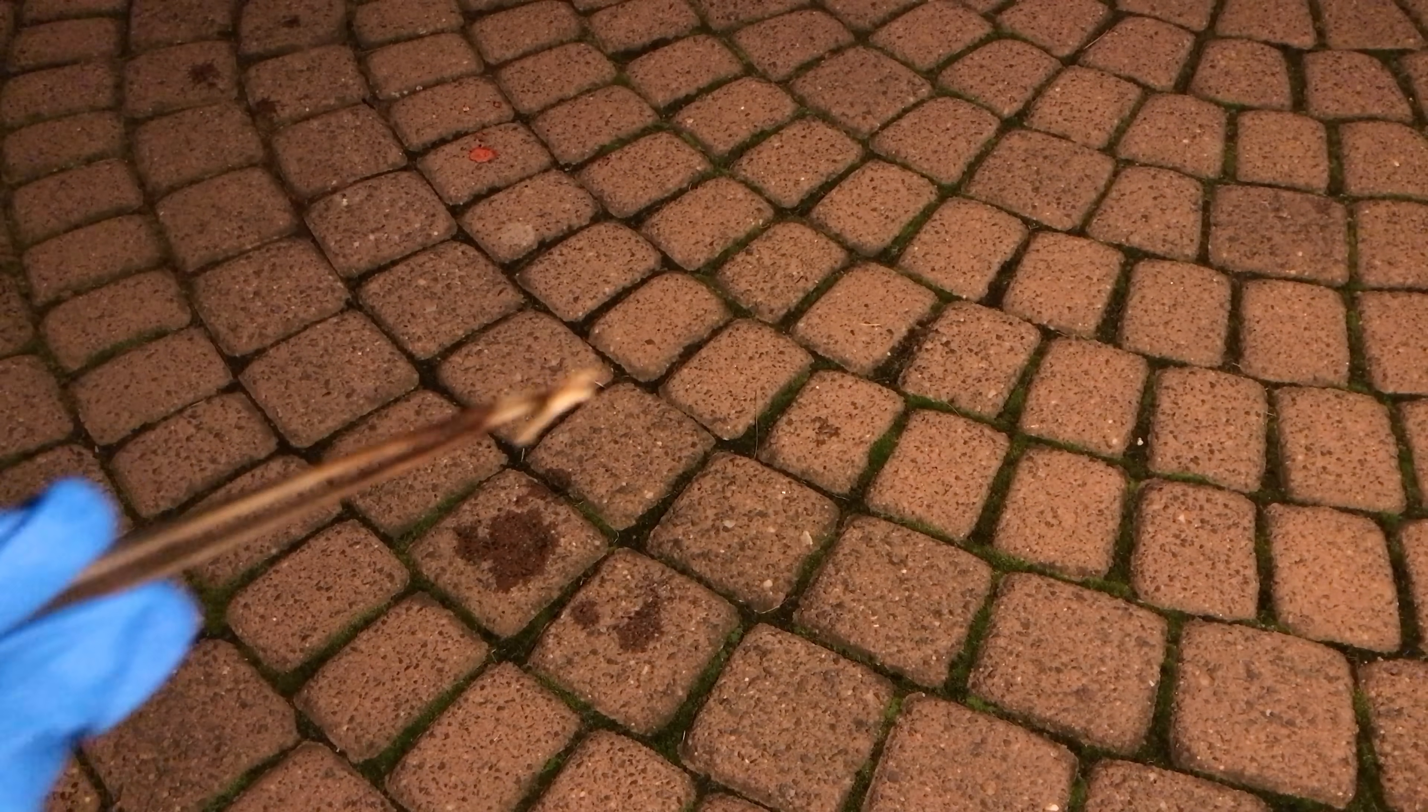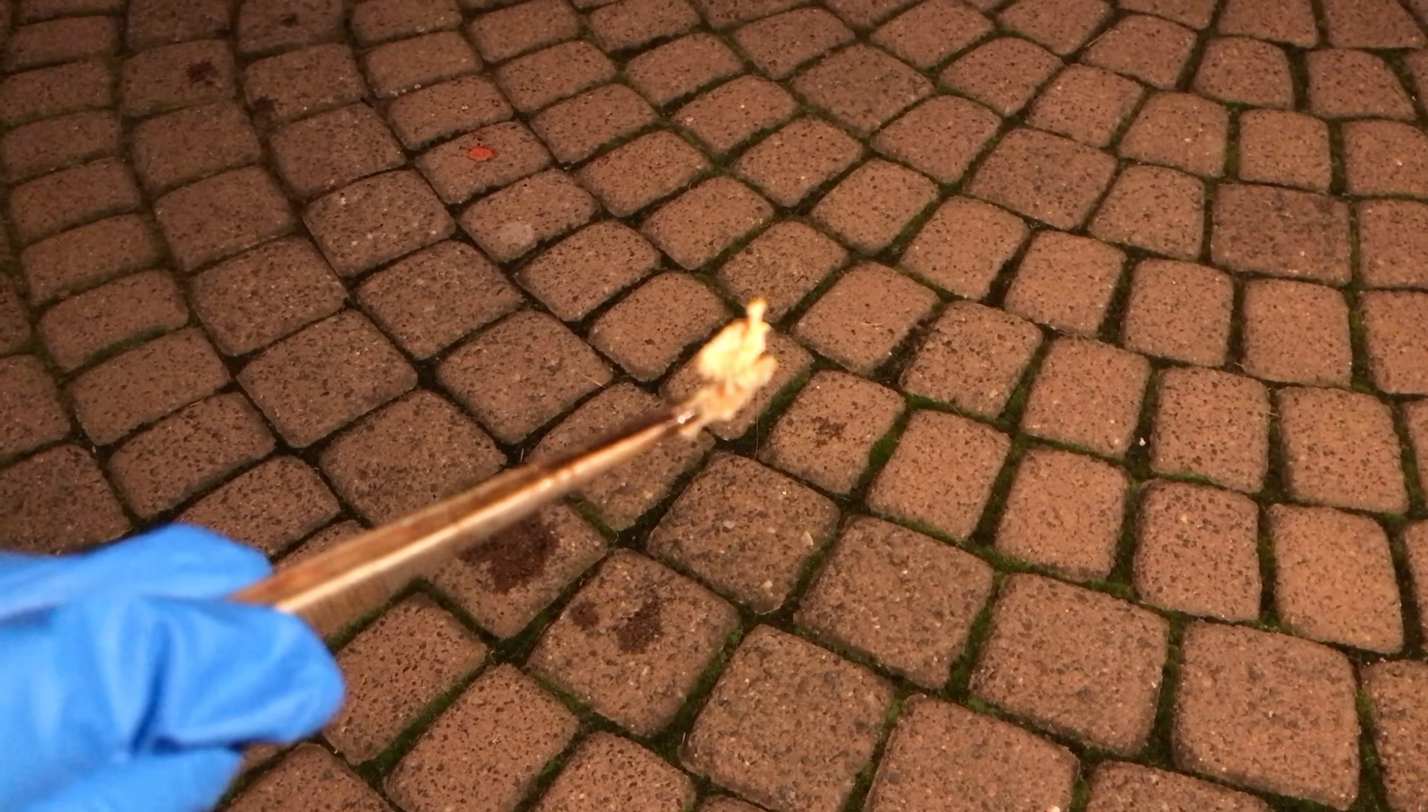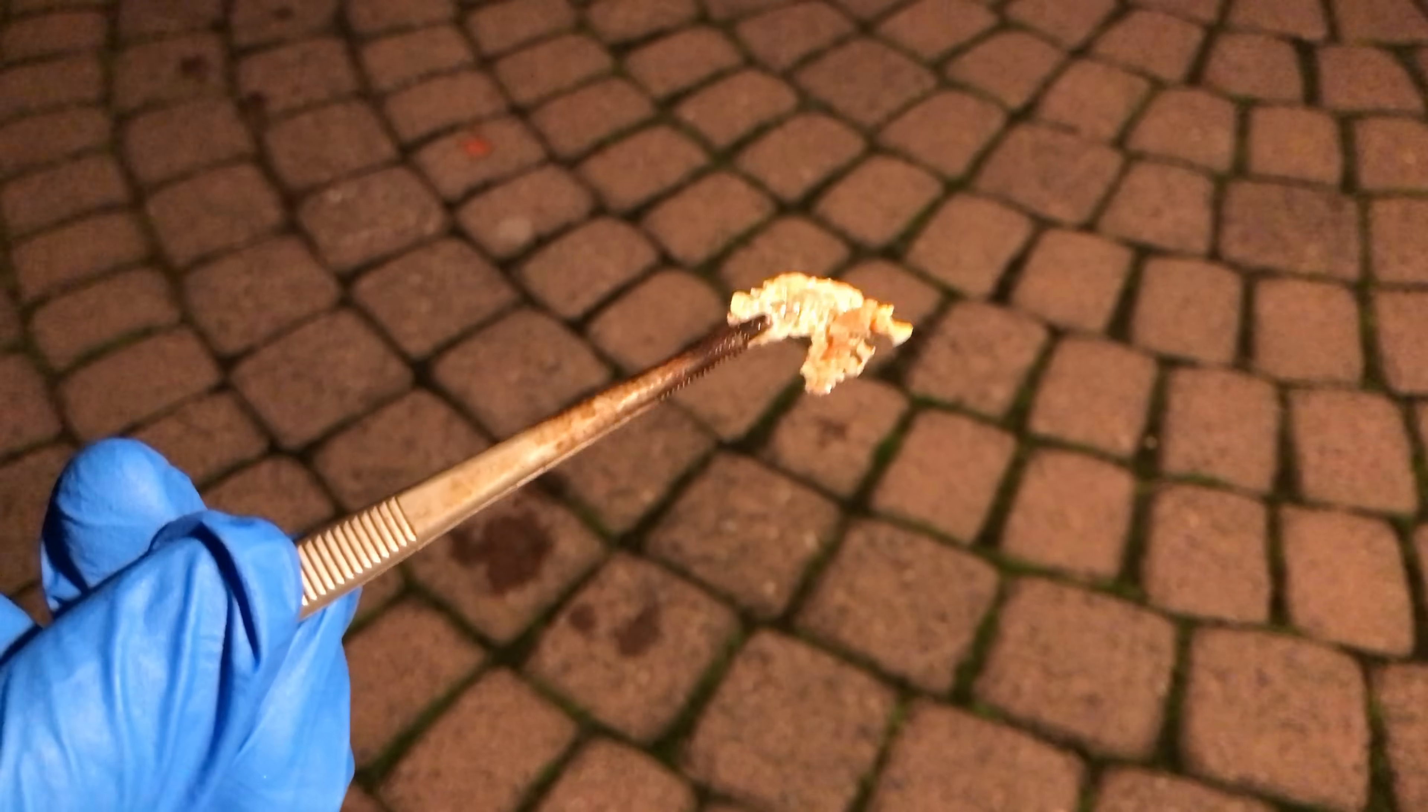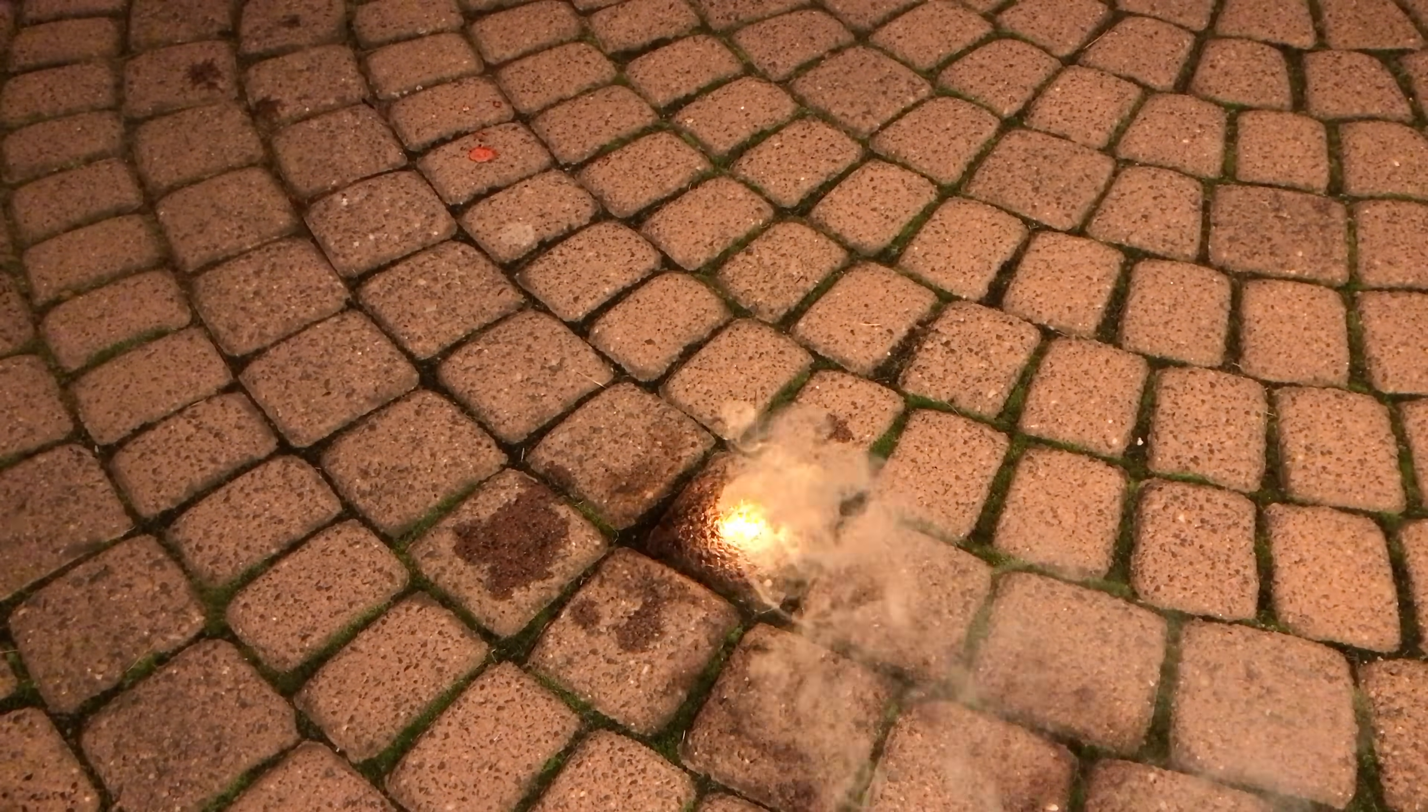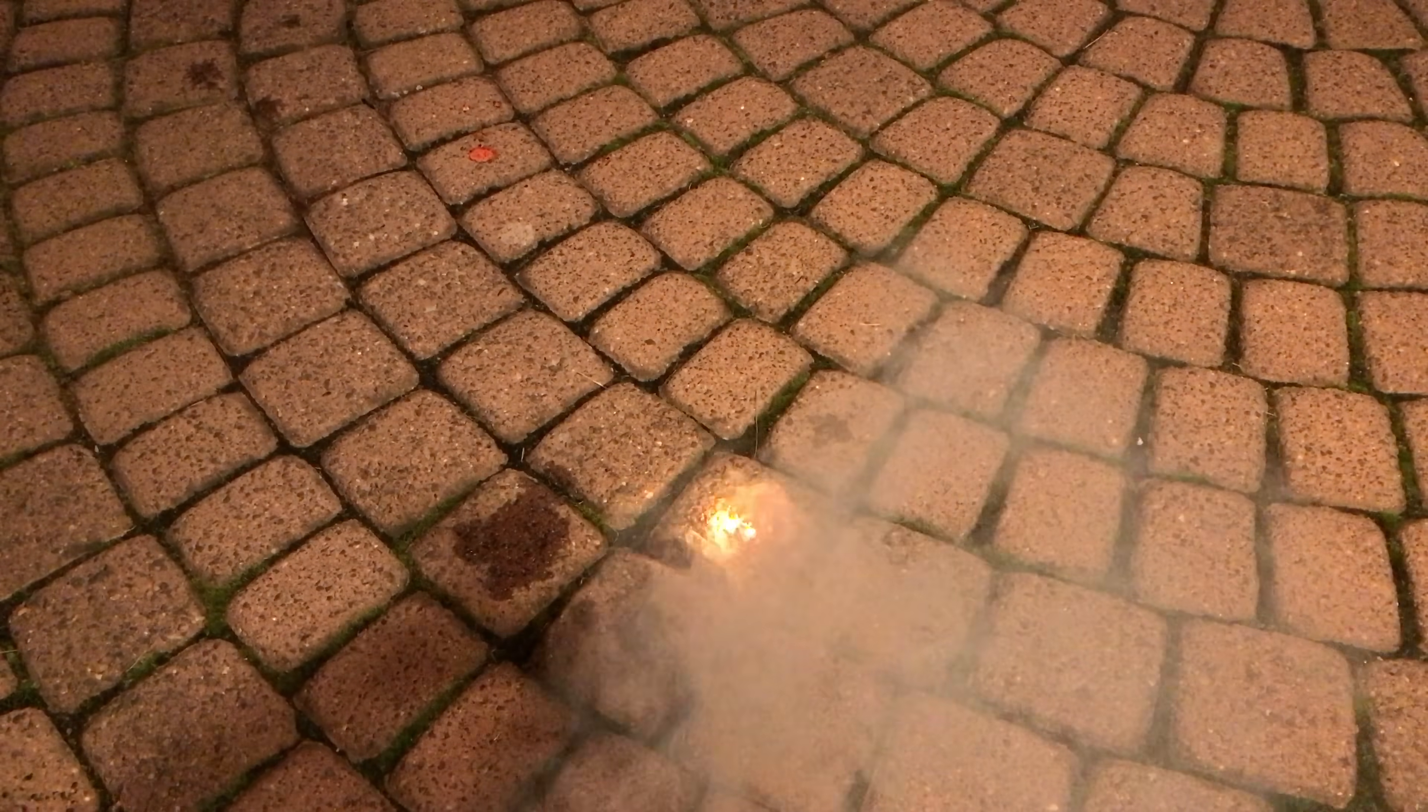This is white phosphorus, which is not ultra pure. I decided to burn it to demonstrate it to you. As you could see, it ignited easily. If you let it sit for long enough, it might even ignite on its own.